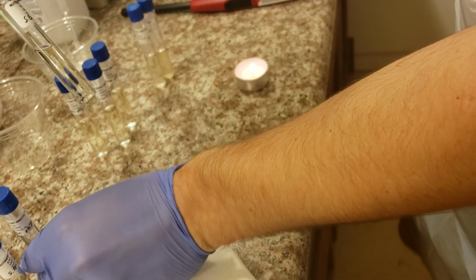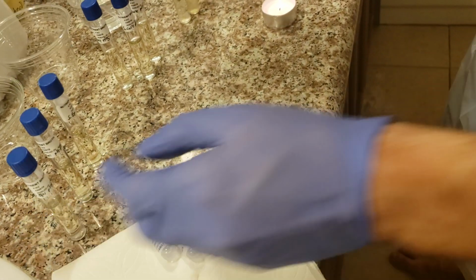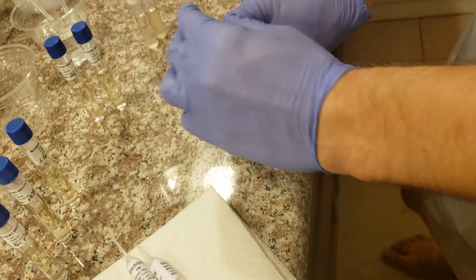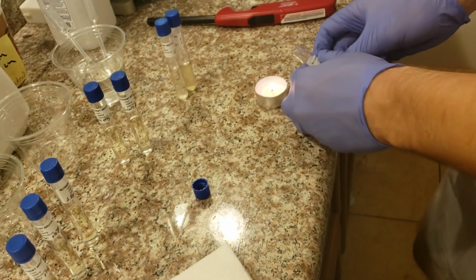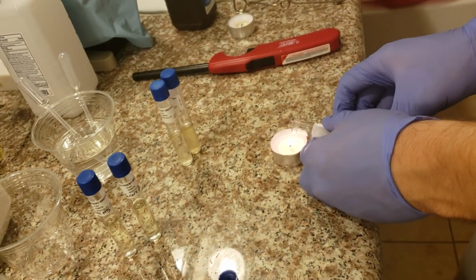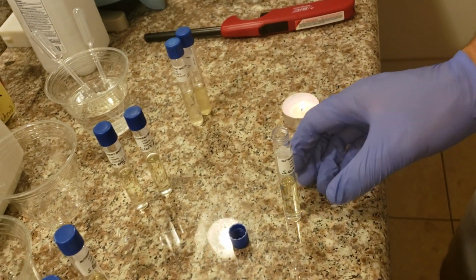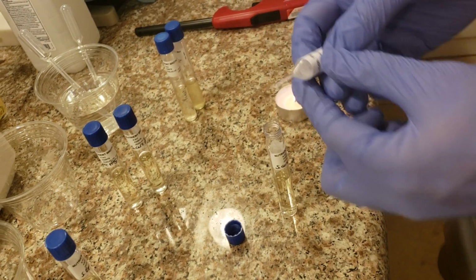So pH 7 is good, and pH 9 is also correct, and that's the S. epidermidis. Next, last but not least, we're also going to do the same for the S. cerevisiae pH 9. As previously stated, we don't really need to mess with the pH 7 vials because they're already at pH 7. We don't need to add an acid or a base to change the acidity. In just a moment, we're going to wrap things up here. So sodium hydroxide, exactly 1 drop. Brilliant.